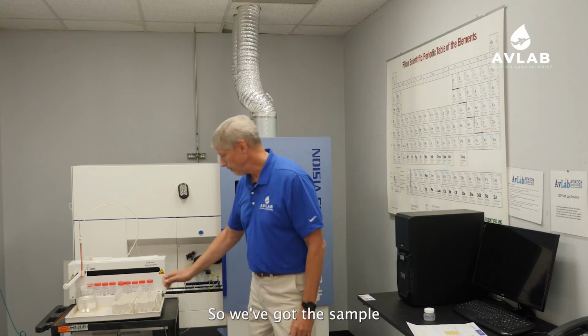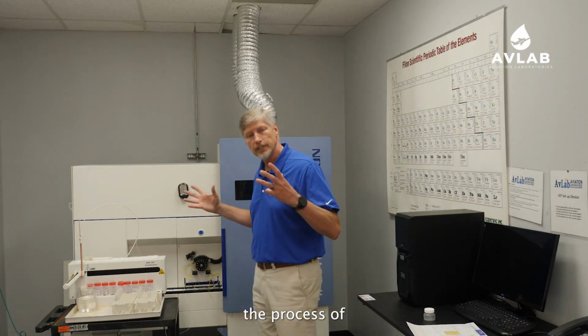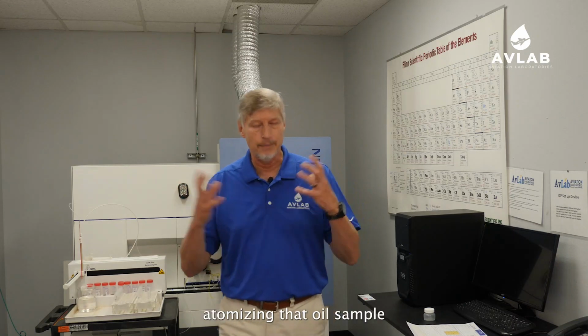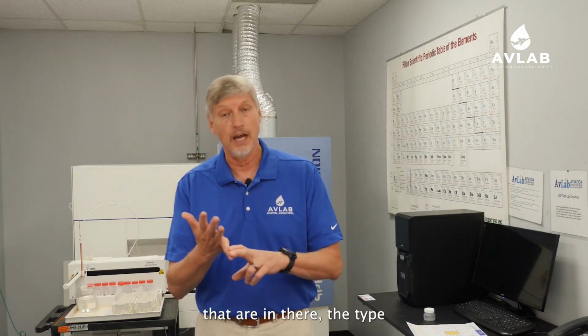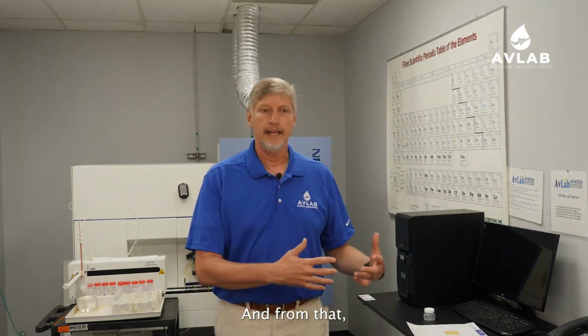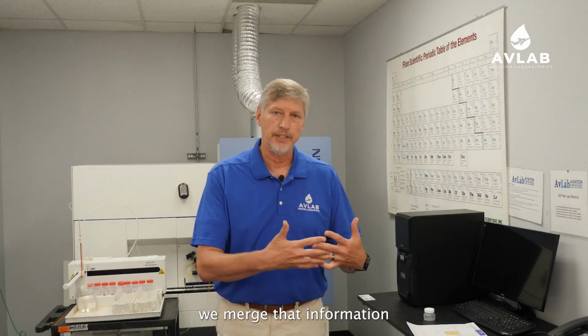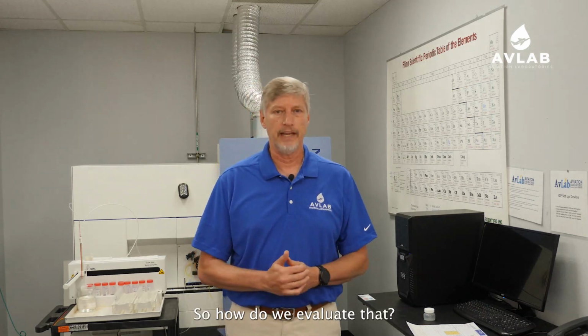So we've got the sample through the instrument, do the process of atomizing that oil sample to pick up the wear metals that are in there, the type and the concentration, and then that data is dumped into the data processing cycle, and from that we merge that information into our laboratory information management system, our LIMS system, and then we can evaluate that within our LIMS system. So how do we evaluate that?